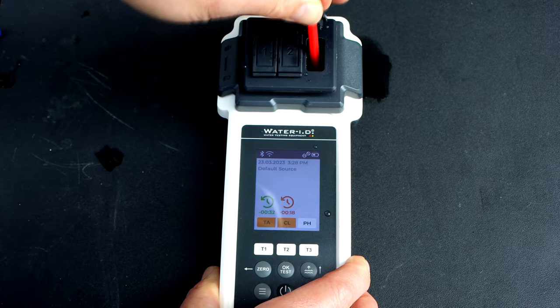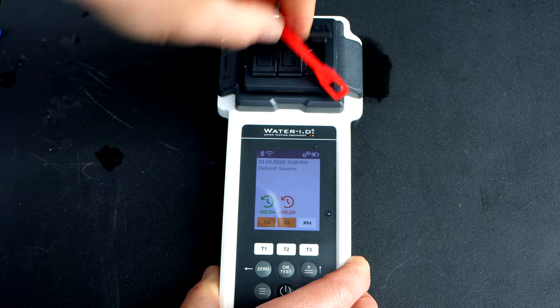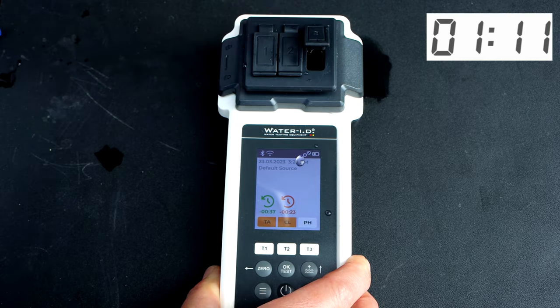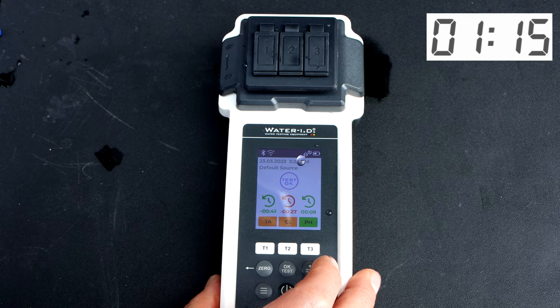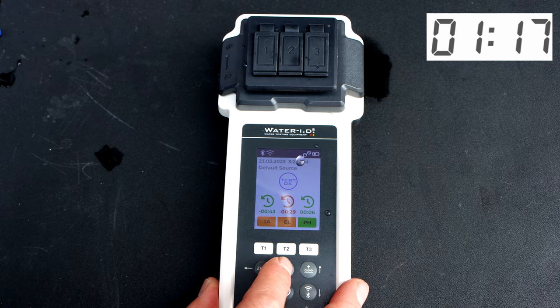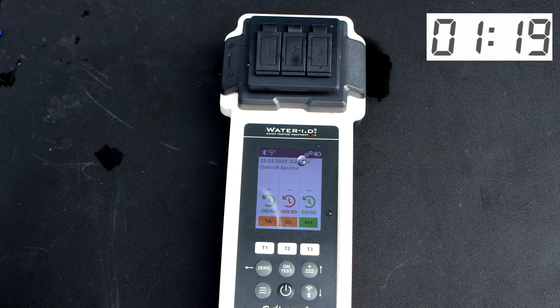The reason why the chlorine came out with a red countdown, there's an ideal time limit to run each test and I was a little bit off with the chlorine. But I've done multiple tests with this unit and I don't think the countdown is super critical in most test factors.